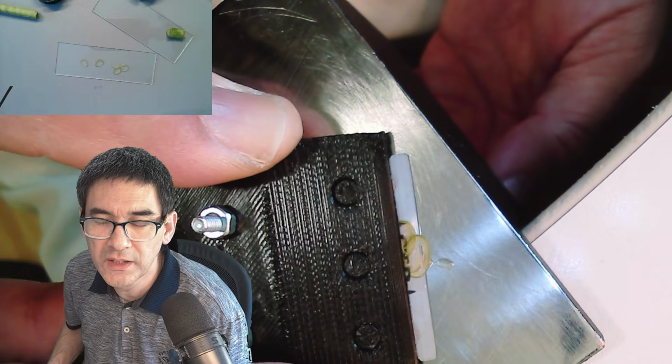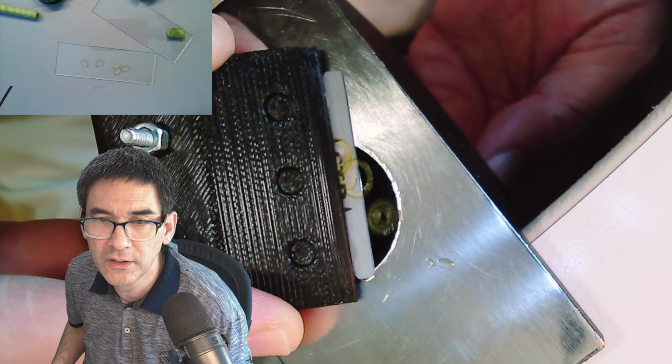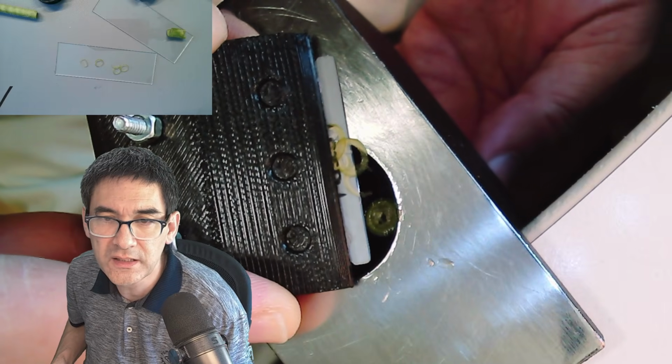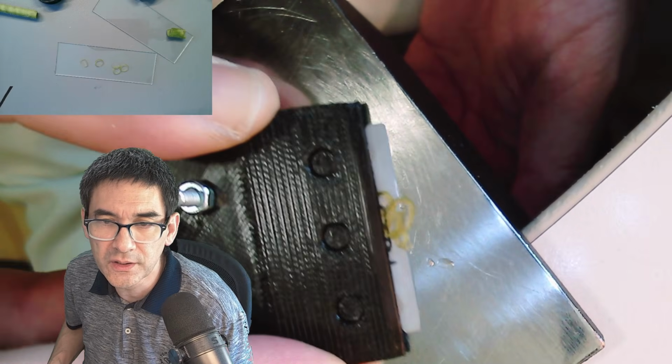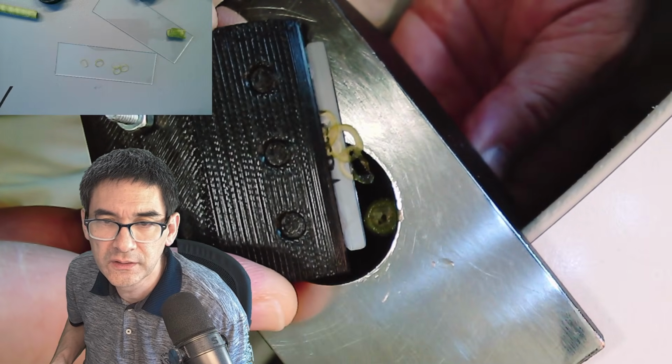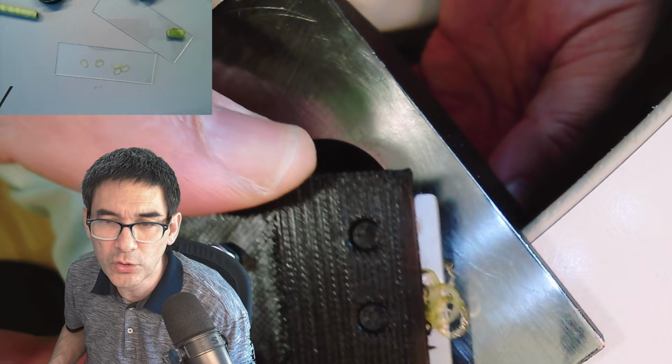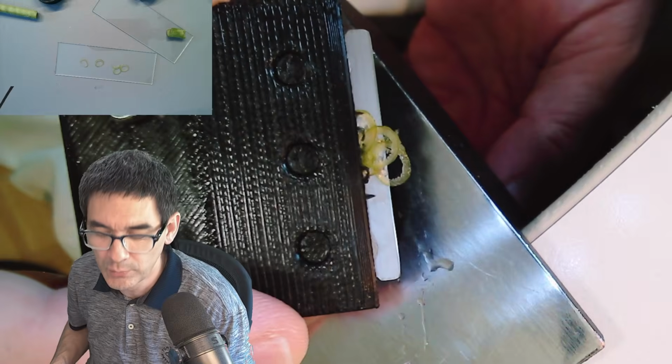Yeah, as always, you have to give it a little bit of trial and error, hoping that the more trials you make, at least some of those cuts are actually going to work. But you see that the fact that the stem is hollow actually makes it way more difficult.